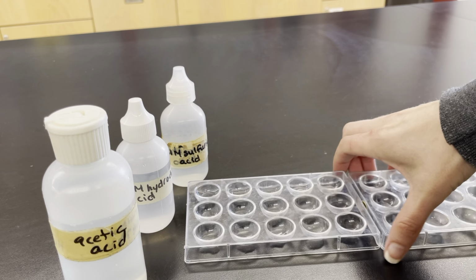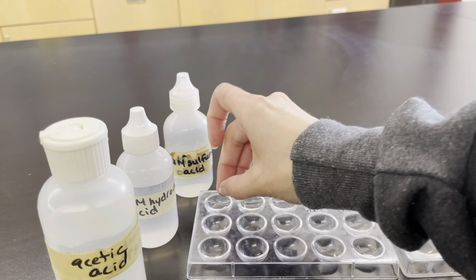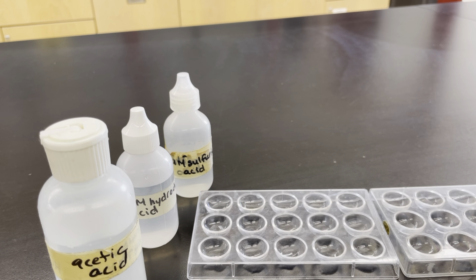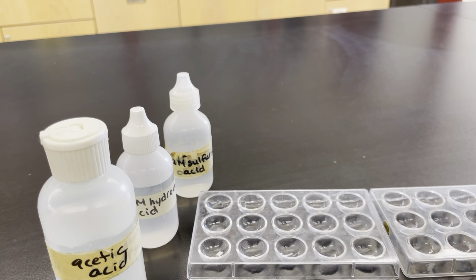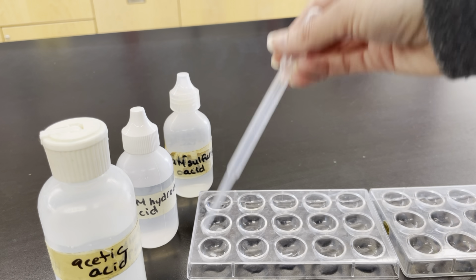First we're going to test it by putting some magnesium ribbon into our acids. I'll drop it in there, and we'll probably have to zoom in pretty close to see if there's a reaction happening. I'm going to make sure they actually get under the surface so that we can have that reaction happen. Sorry, I have to use a different one just to make sure we're not contaminating the samples.